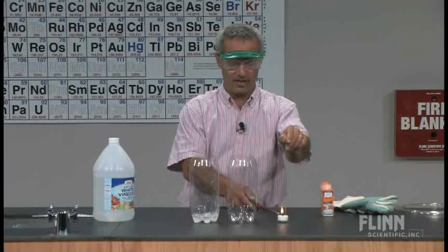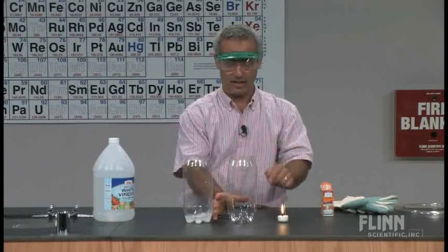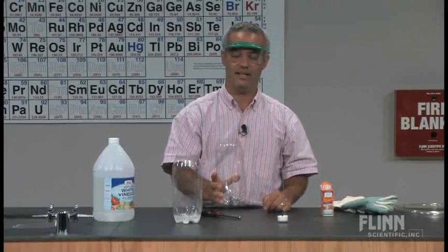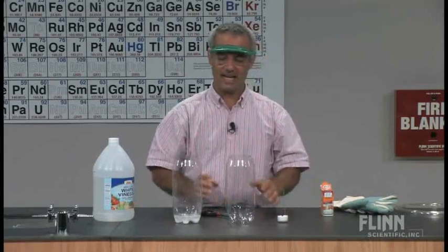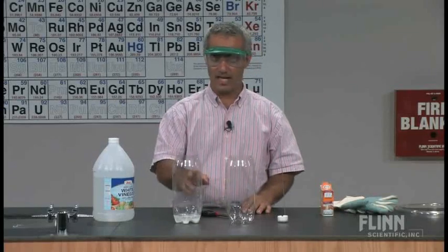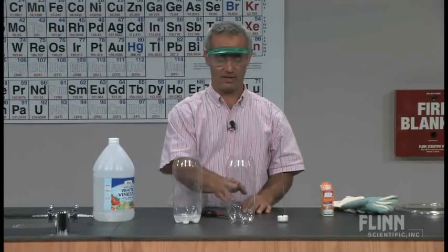The other thing you can do with this demonstration is just pour the gas directly on the candle. Of course you have to do it kind of quickly and just pour it out like that. But I kind of like doing it here and then pouring it. You don't really know if it's been poured or not. So gas being poured from one container to the next.